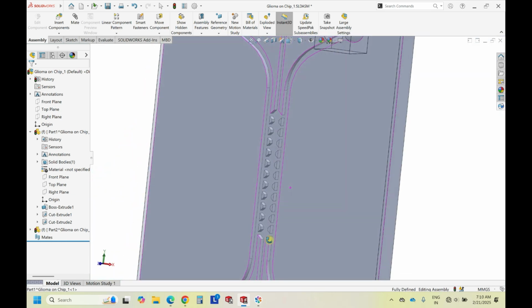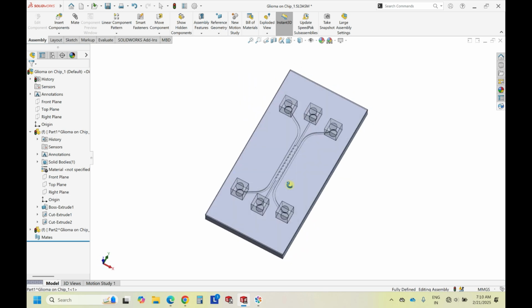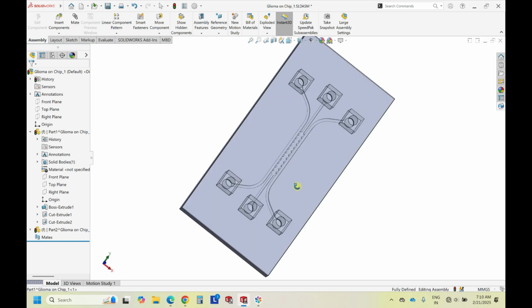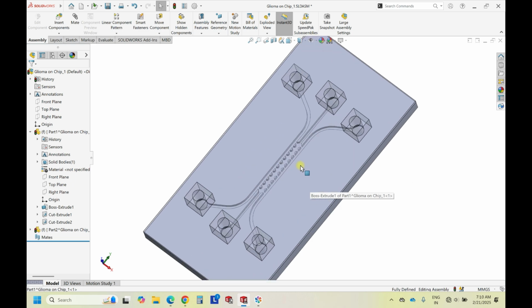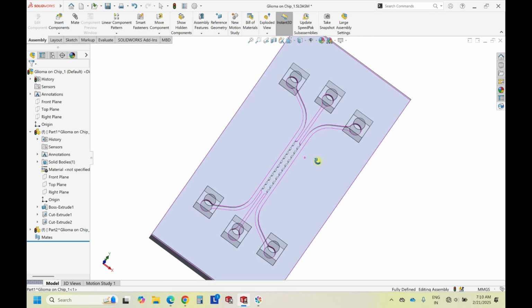This is how it looks. Okay, and then if you want to print it, just save it into STL files, and then I think in one of the videos we showed the helical structure, how to print the 3D helical structure. The same way you can save into STL files and just continue printing and doing your microfluidic work.